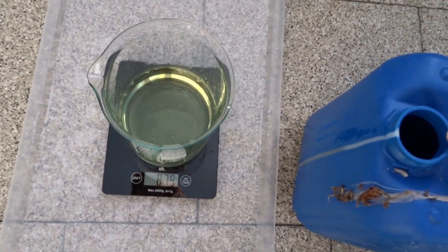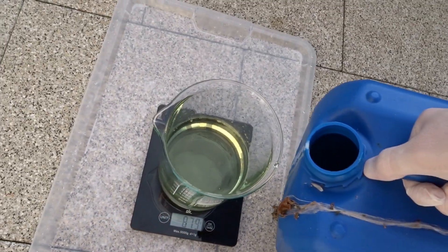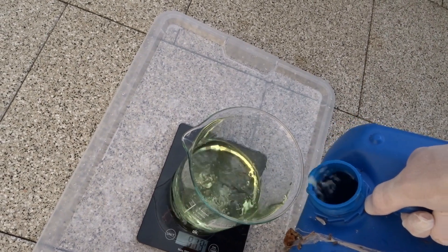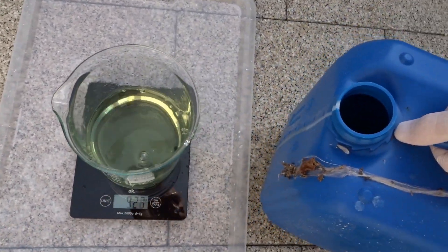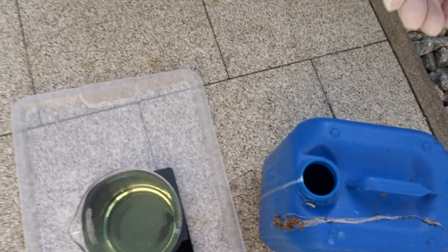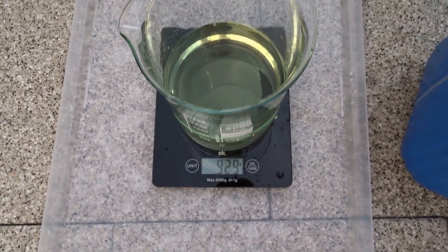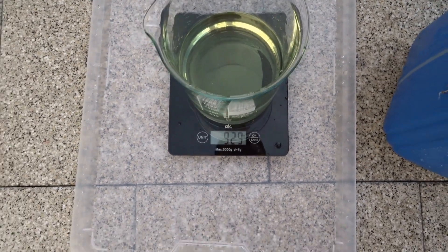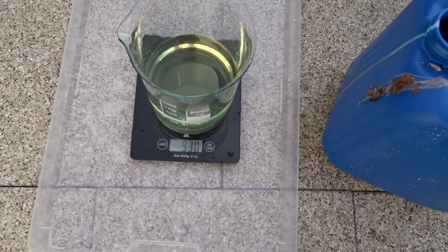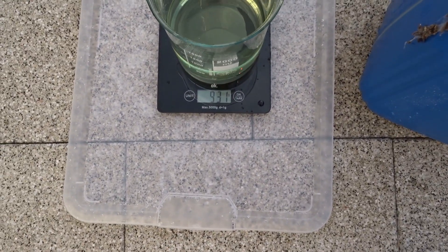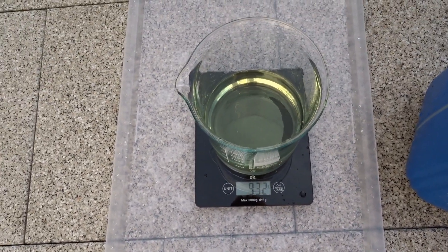880, still a bit missing. It splashed. You know what? I'm better going to take it with both hands now. This is really stupid. I got the splash right on my goggle. Glad I was wearing this this time. So I'll be right back.